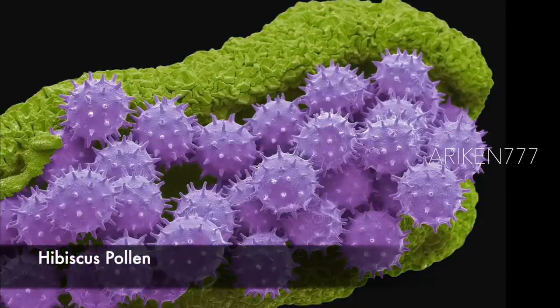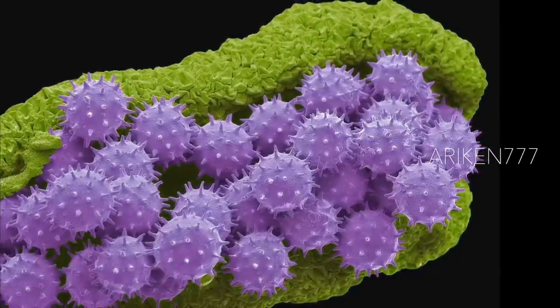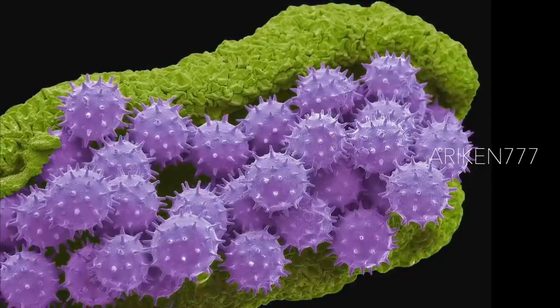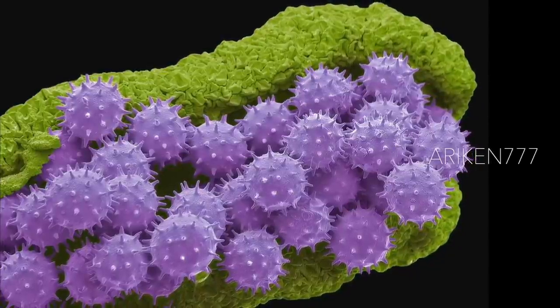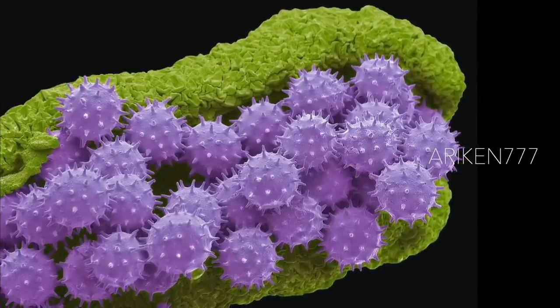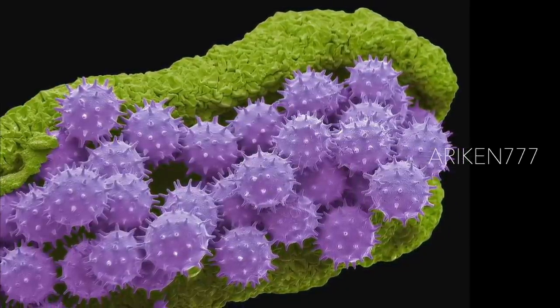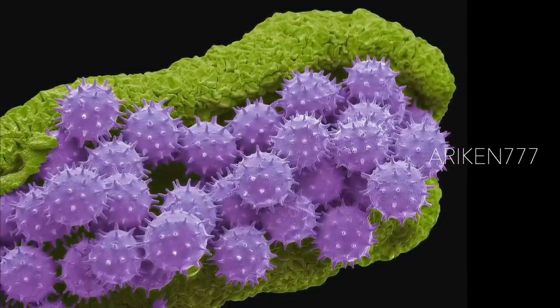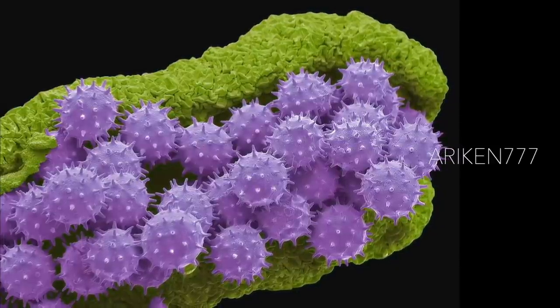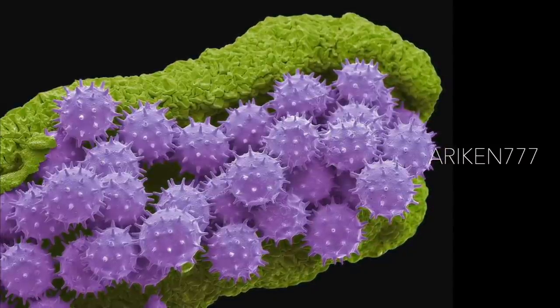Pollen grains on the anther of a Chinese hibiscus flower. Pollen grains are the male gametes or sex cells of a plant. The grain has a highly sculptured outer wall, which may assist in its dispersal by improving the adherence to pollinating insects. Pollen grains are microscopic, usually about 15 to 100 microns across, and just a pinch of pollen powder contains thousands and thousands of grains.